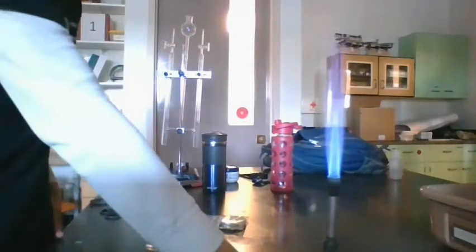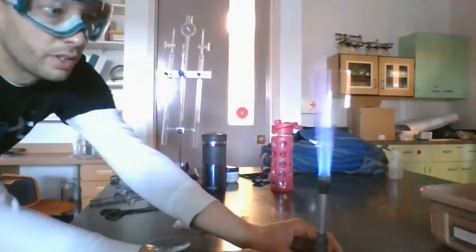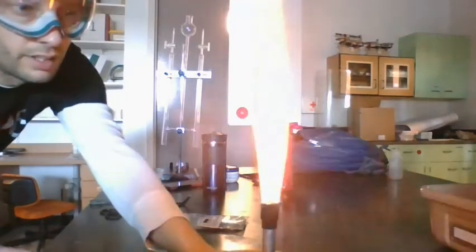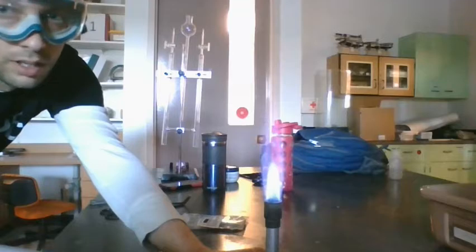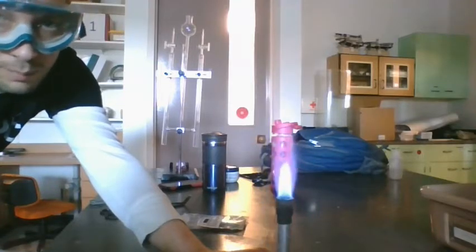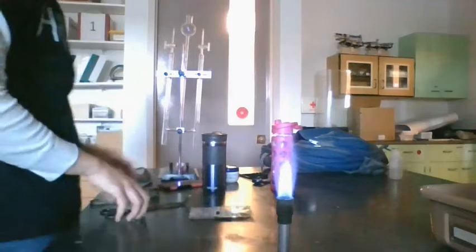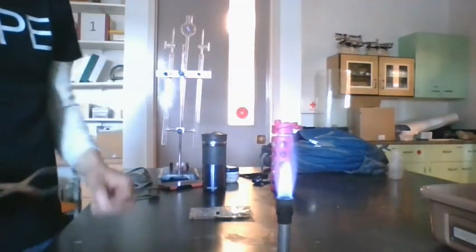The best I can do is maybe some light from somewhere else. But we got our Bunsen burner. Let's see if I can tighten this a little bit. Yeah, now we got that blue. See that bright blue flame on the inside? That's what we want. That's the real hot part of the flame, right about right there.